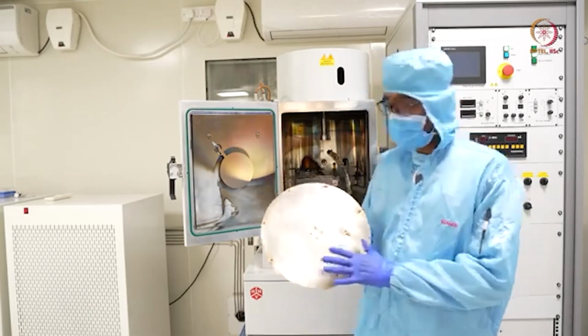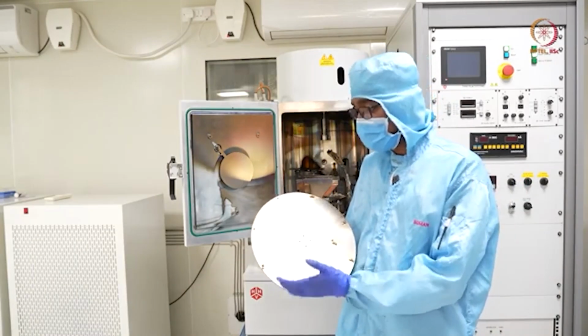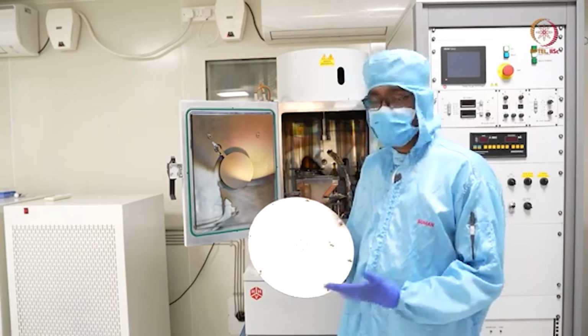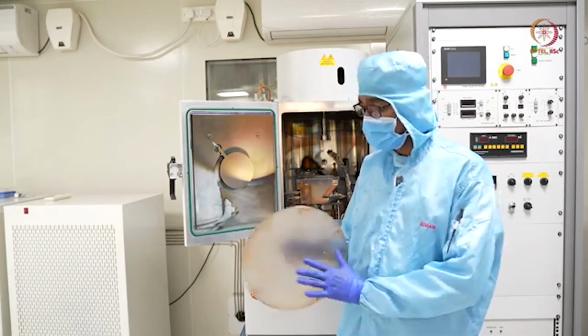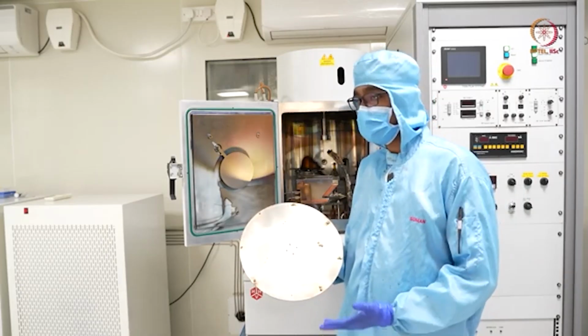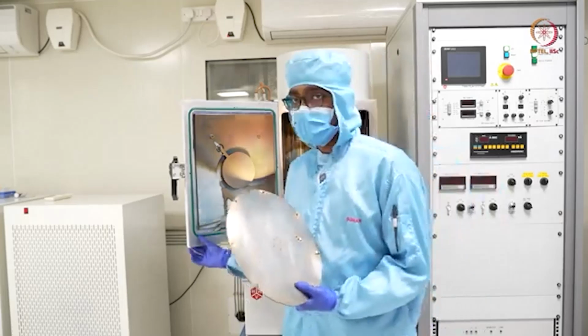This is the chuck that we will be using. This is a 12-inch chuck. 12-inch chuck means the chuck diameter is 12 inches. So like that, you can use different diameters and different materials, whether it is SS or some other material that is of your choice when you procure it. Let us load.